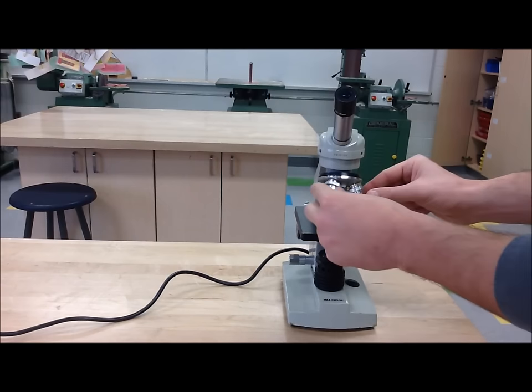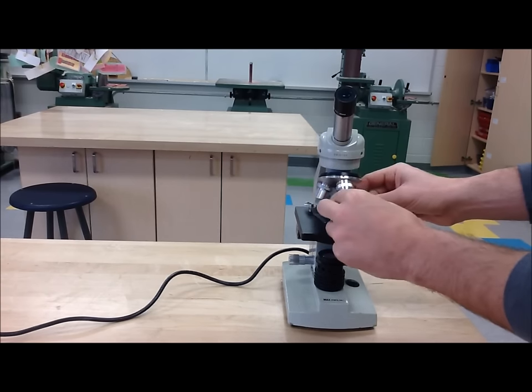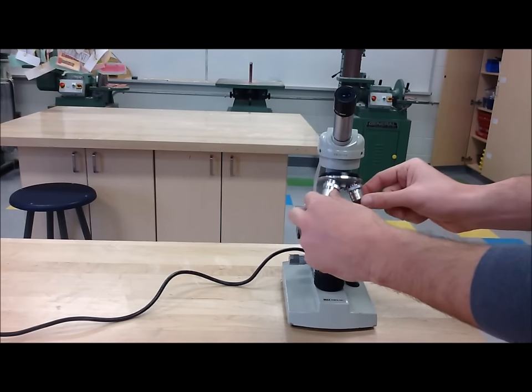Step 4: Be sure to have your lenses in a neutral position. That means to have it in between objective lenses.